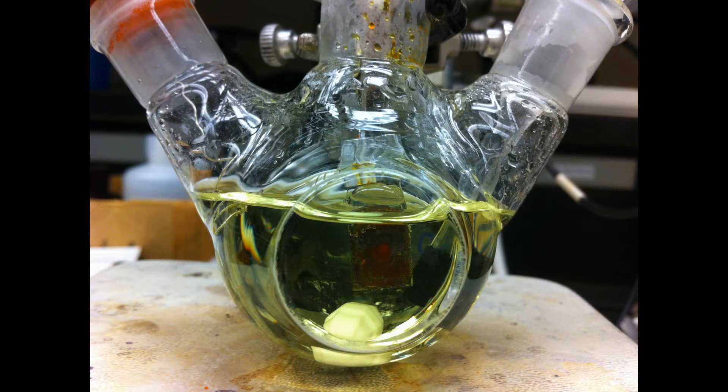When we're ready to measure the properties of a photocatalyst sample, we dispense a film of the material onto a conductive substrate, like glass coated with fluorine-doped tin oxide, then place it into this electrochemical cell that contains an electrolyte solution, a platinum counter electrode seen here on the left, and a saturated calomel reference electrode seen on the right.